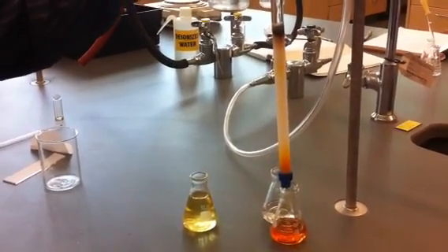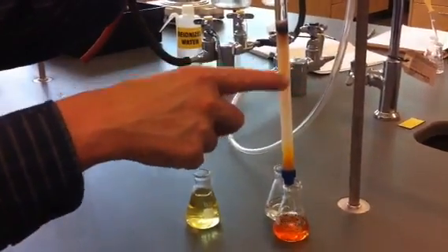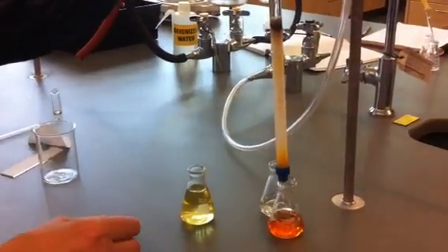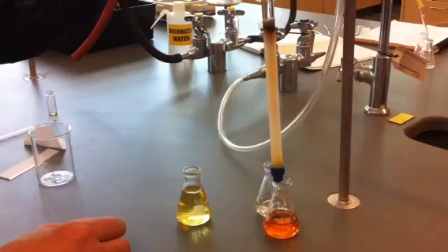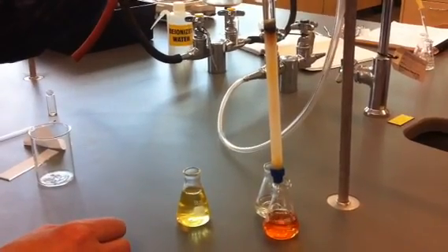Almost there. There's another compound up here that's starting to come out, but we're not going to take that one out. You mean this diacetyl? That's probably the diacetylferrocene.